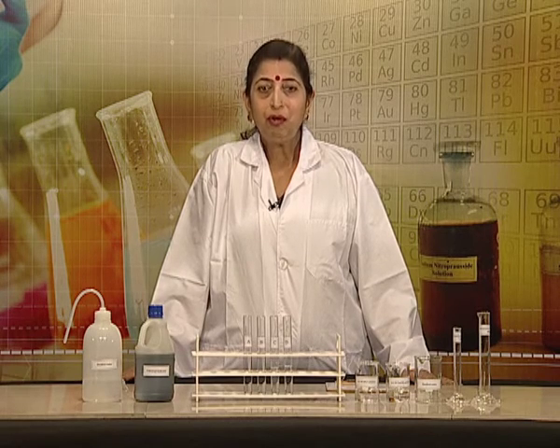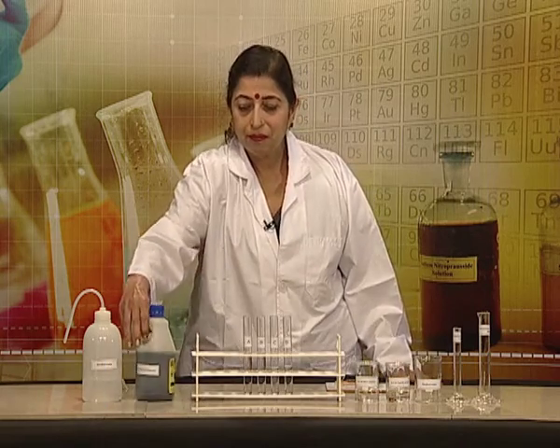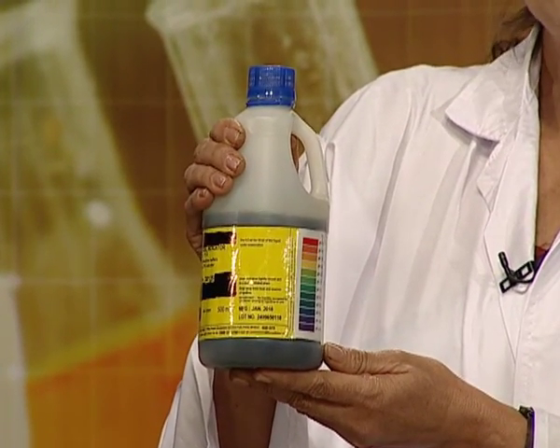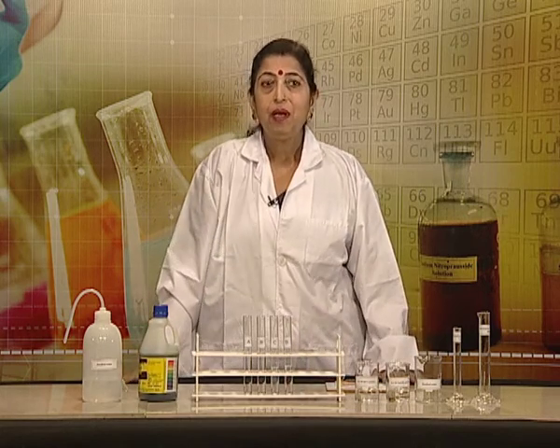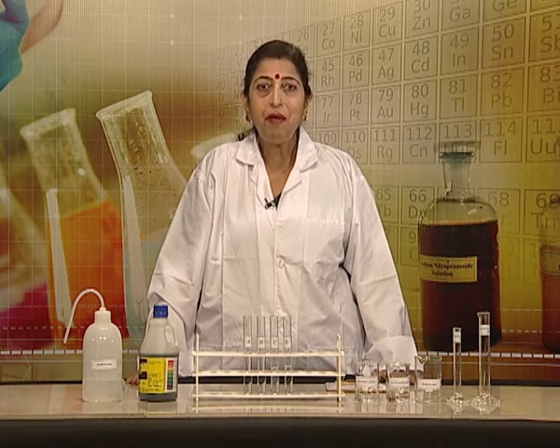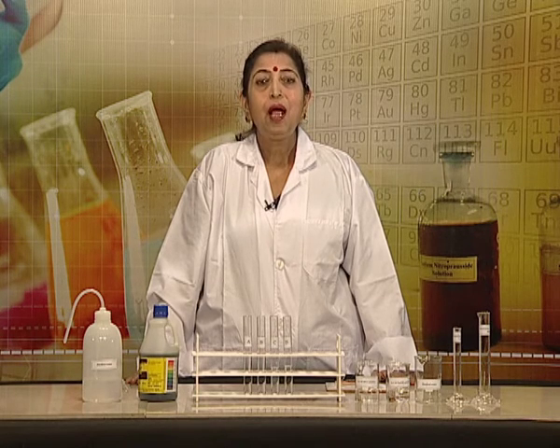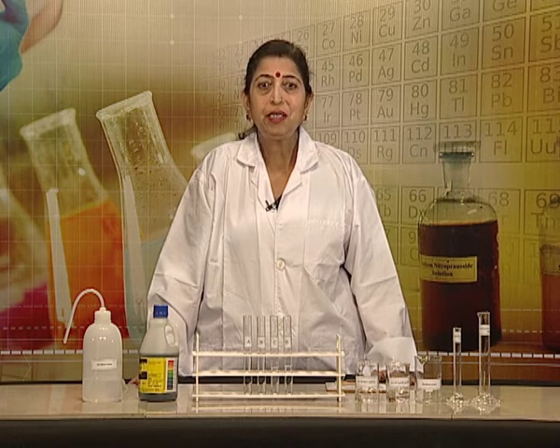If pH paper is not available, we can use universal indicator solution. The color developed in the test solution can be compared with the reference pH paper chart. While doing the experiment, we have to take care of a few points. pH paper should be kept away from chemical fumes. The color developed on pH paper strip must be matched carefully with the reference chart. If we are using indicator solution, equal drops of pH indicator should be used for each test solution.